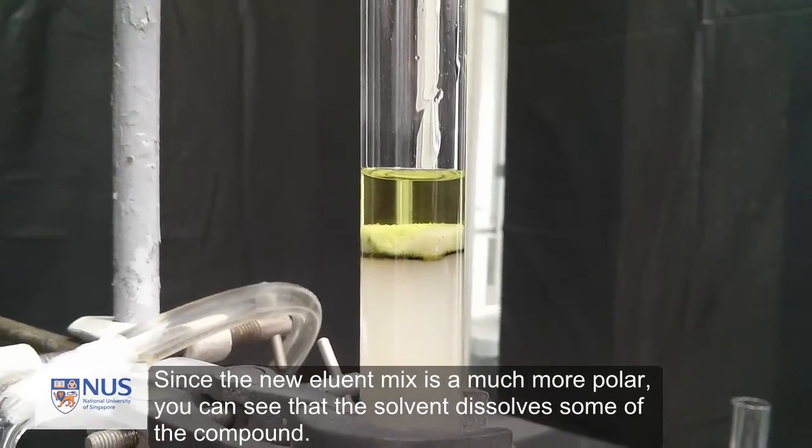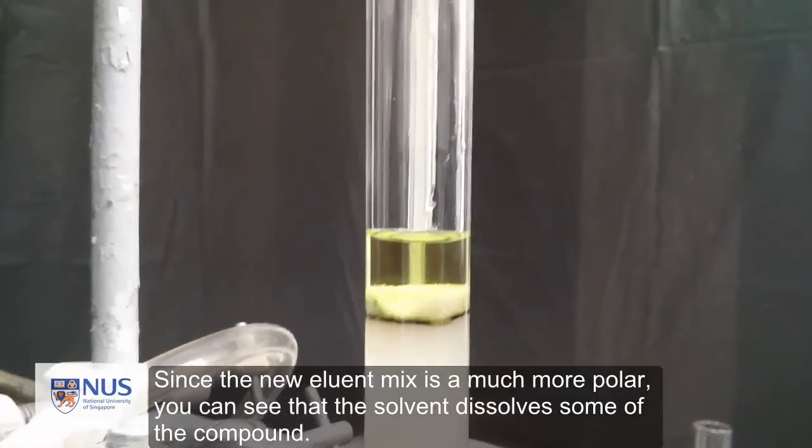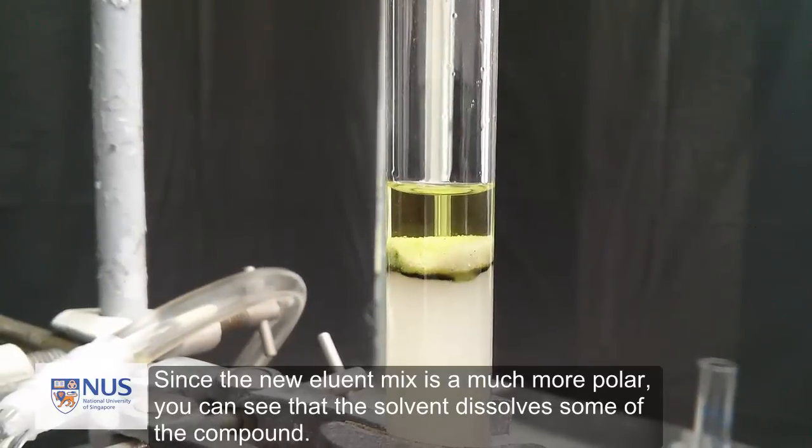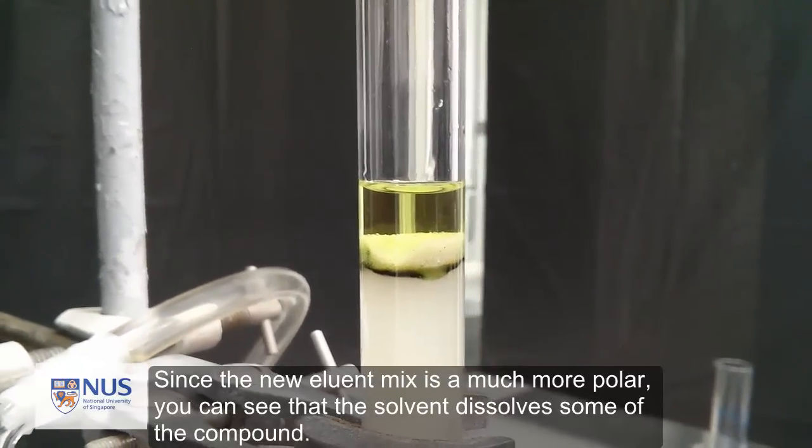Since the new eluant mix is much more polar, you can see that the solvent dissolves some of the compound.